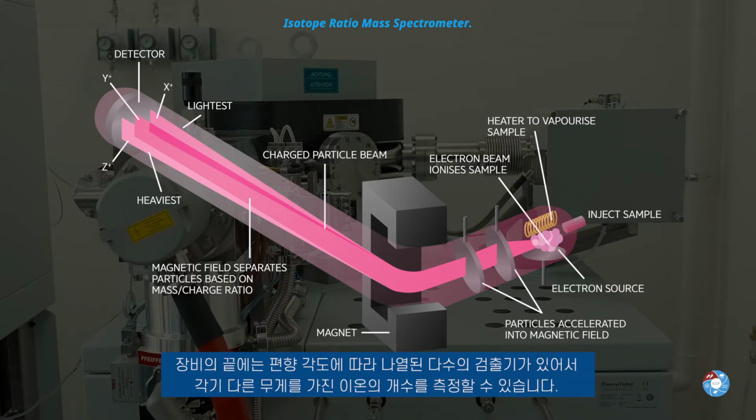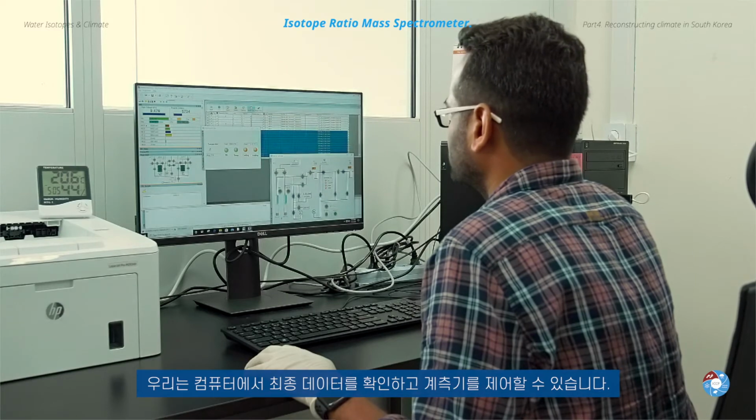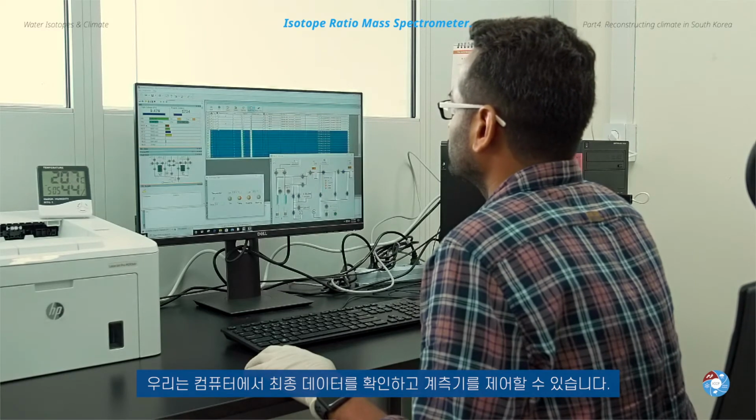At the end of the instrument is a detector that measures the number of light to heavy ions according to their deflection angle. On the computer, we can then see the final data and control the instrument.